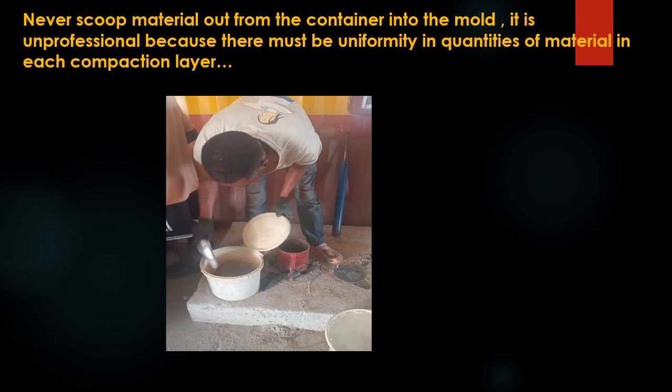Never scoop material out from the container into the mold. It is unprofessional because there must be uniformity in quantities of material in each compaction layer.